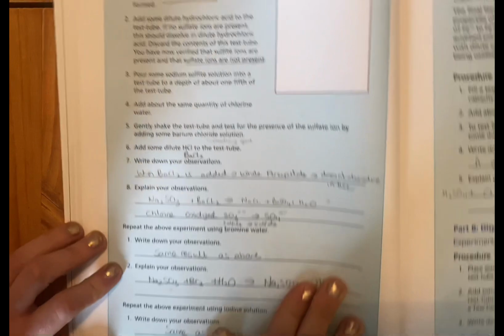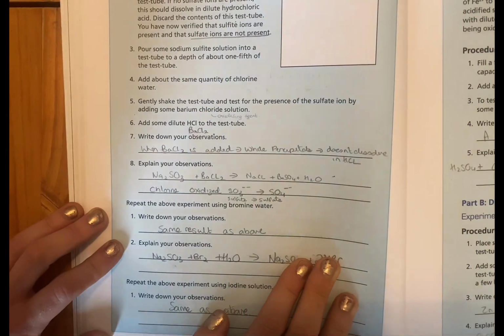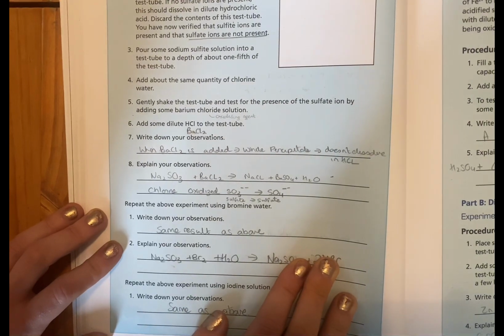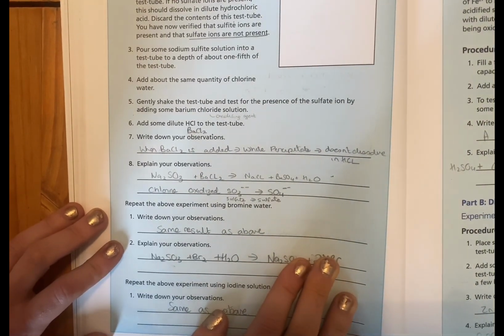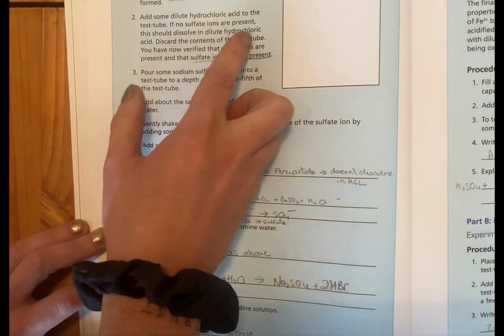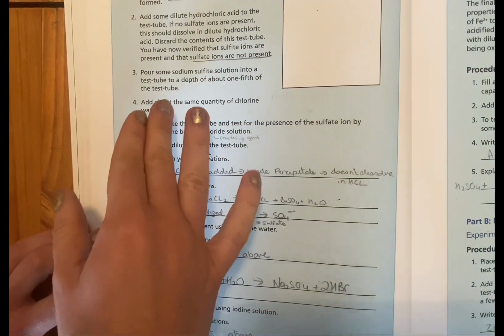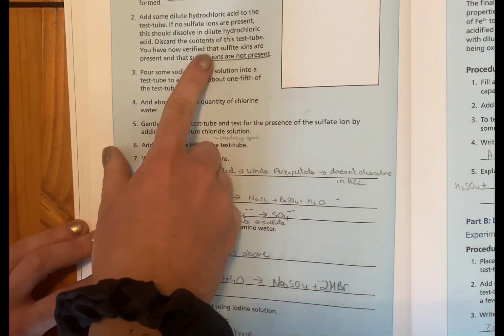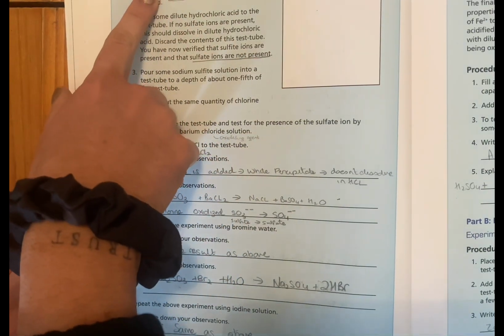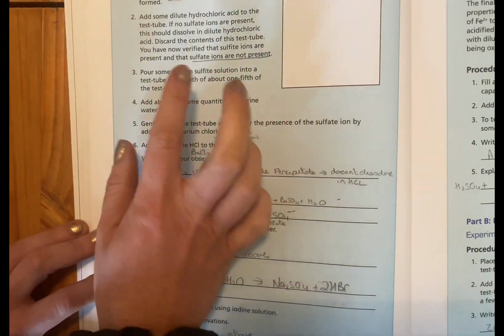Okay, then over here, in the next experiment, we have barium chloride and sodium sulfite. A white precipitate is formed. The HCl added in then signifies if there are sulfate or sulfite ions present. So if there are no sulfate ions present, that precipitate should dissolve in HCl. So we'll go back to clear, and that means that if there's no sulfate, there are sulfite ions present, okay? Because we do have sodium sulfite in the actual test tube. So we know there's no sulfate at the moment.